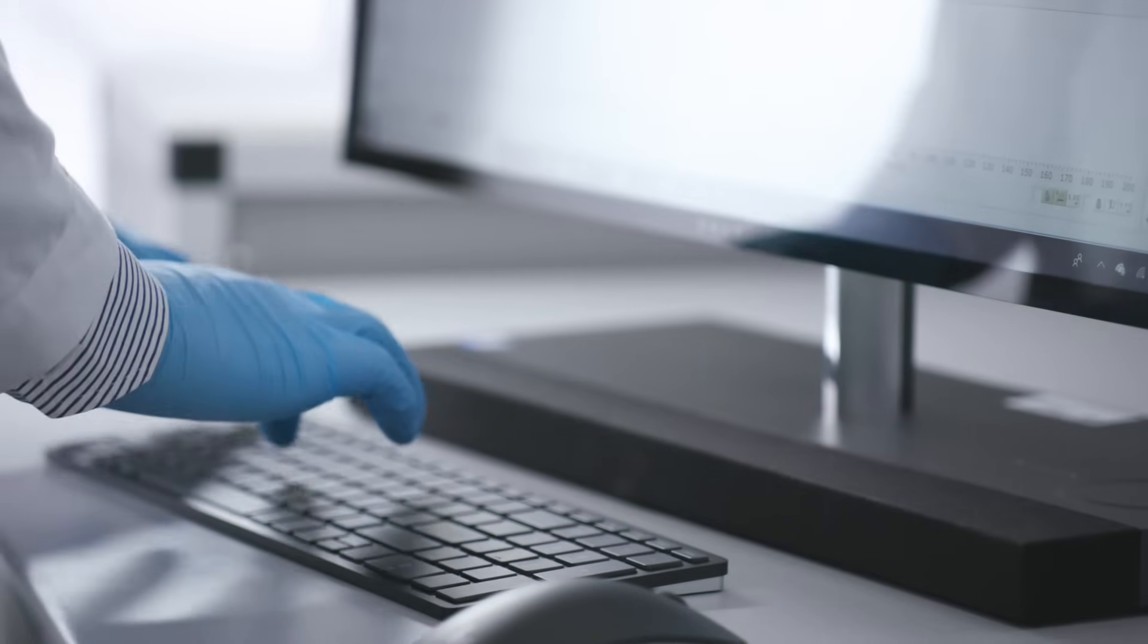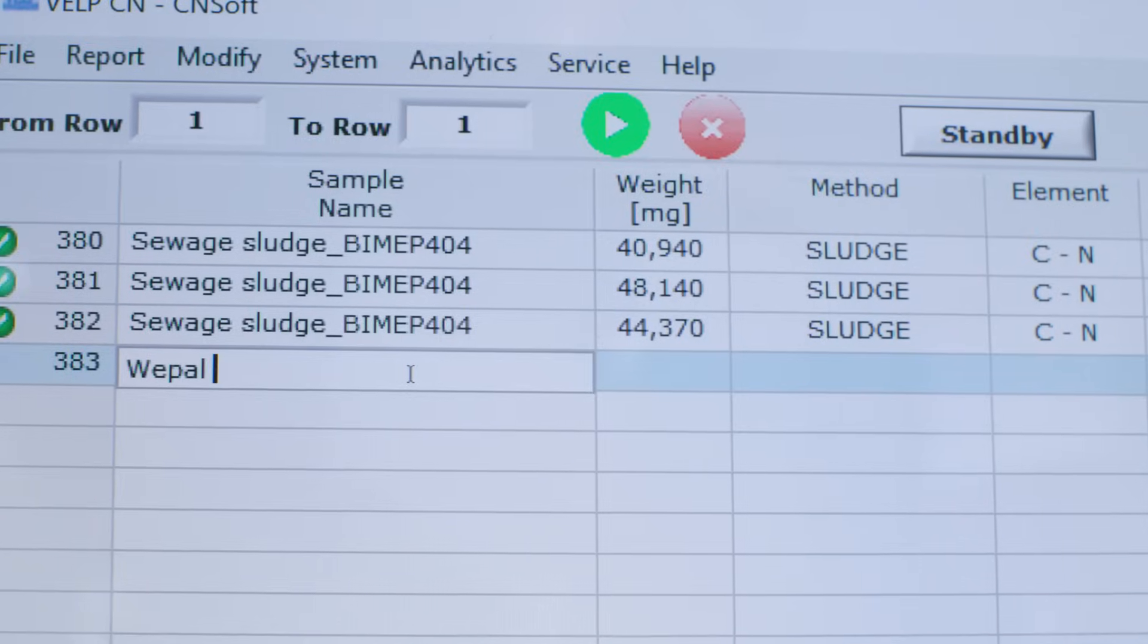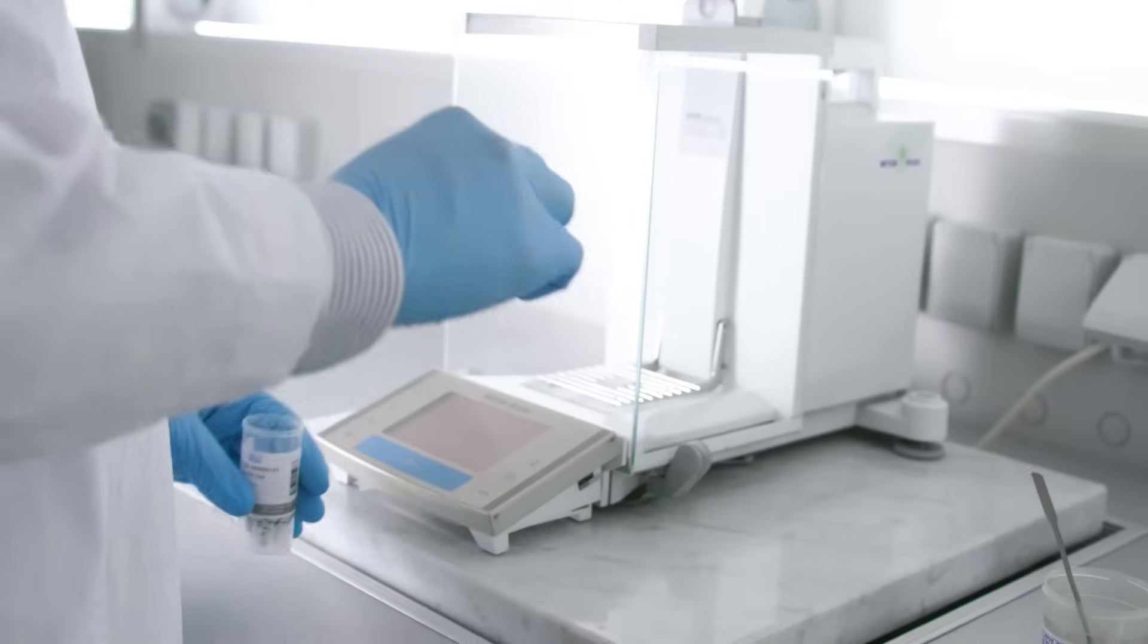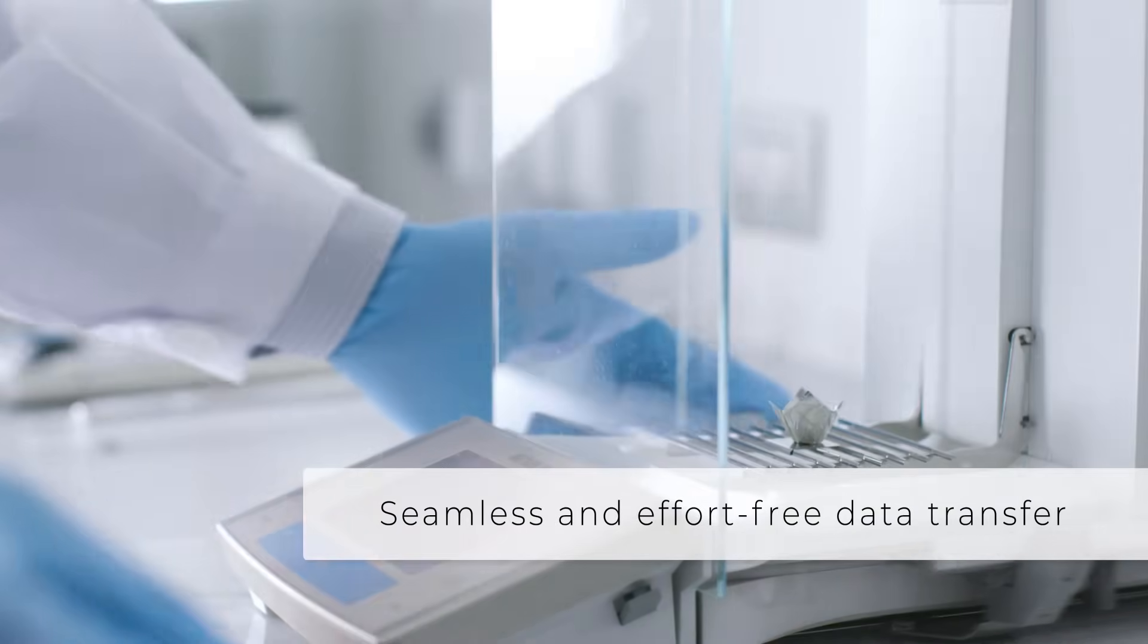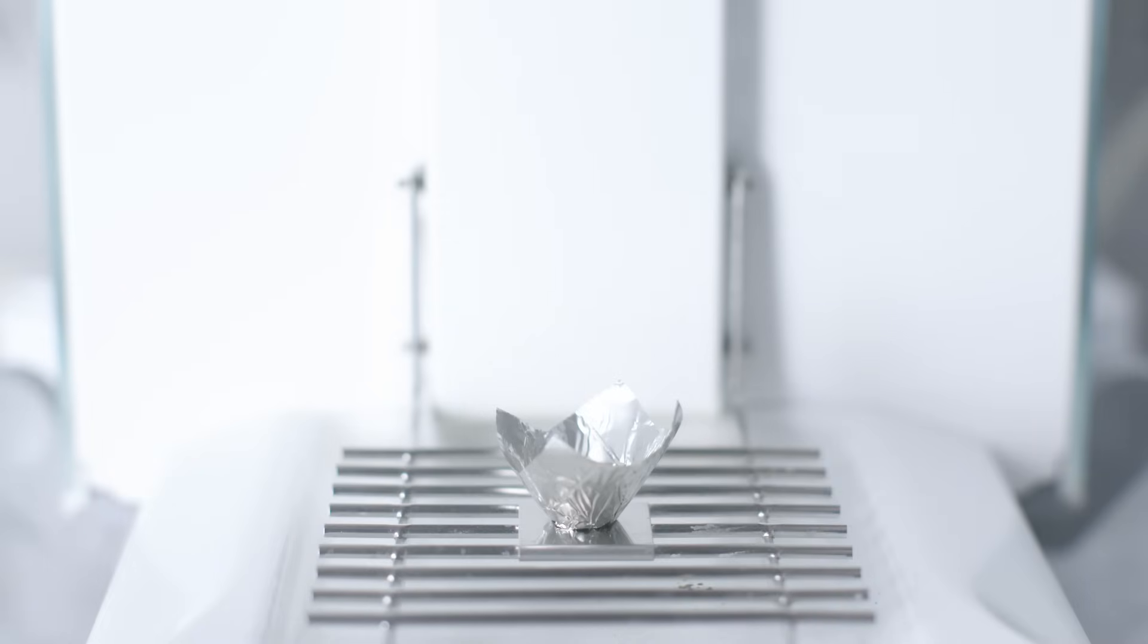Fill in the database on the CNSoft software with the sample information. Weigh your sample and place it in the convenient tin foil. Data is automatically transferred from the balance to the CNSoft.